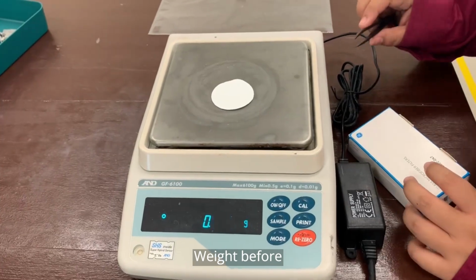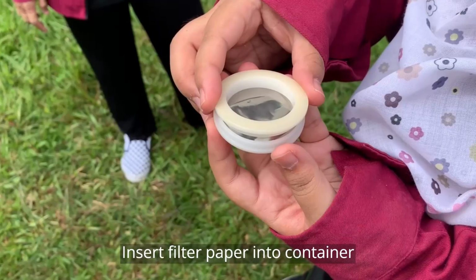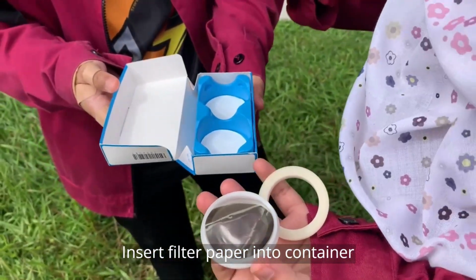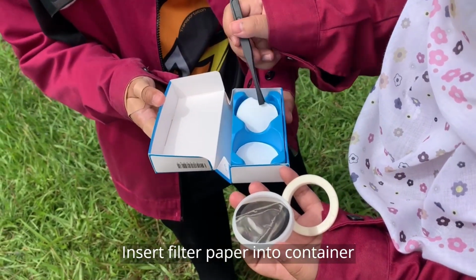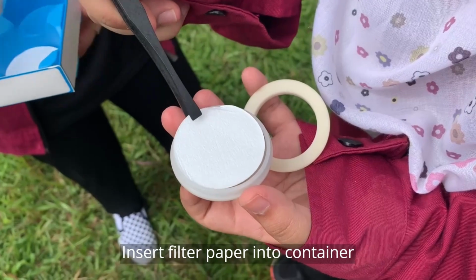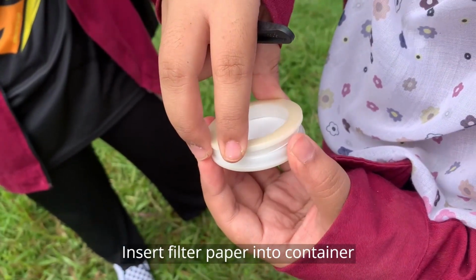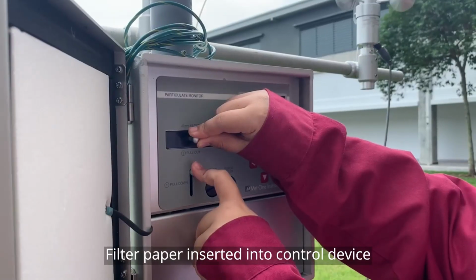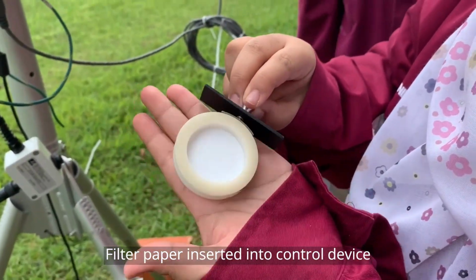Procedure in the experiment of air sampling. First, we weigh the filter paper before the experiment starts. The weighed filter paper was inserted into the special container for the sampler. During the process we must use forceps to avoid contaminating the filter paper. Then, carefully insert the filter paper into the control device by pulling the lever on the e-sampler device.